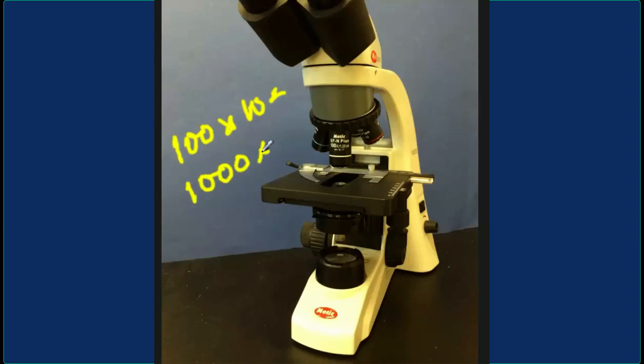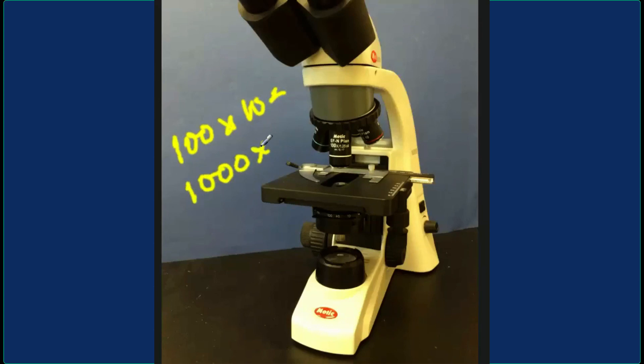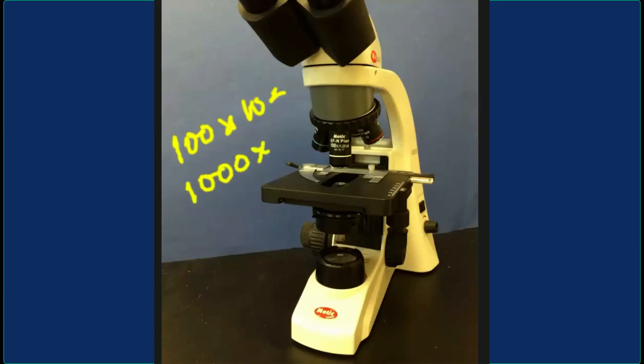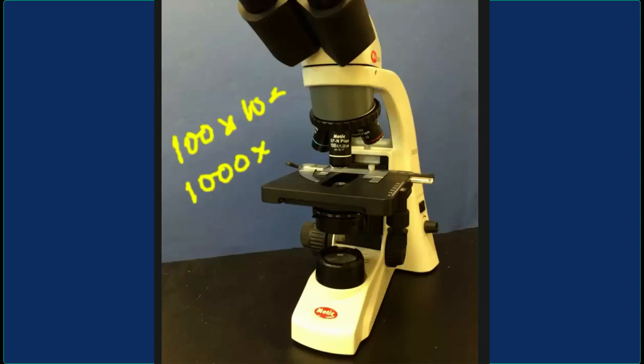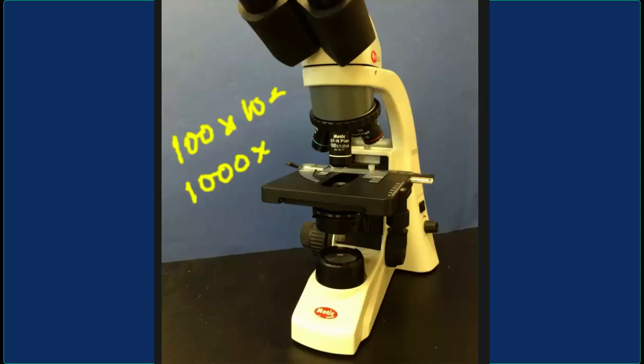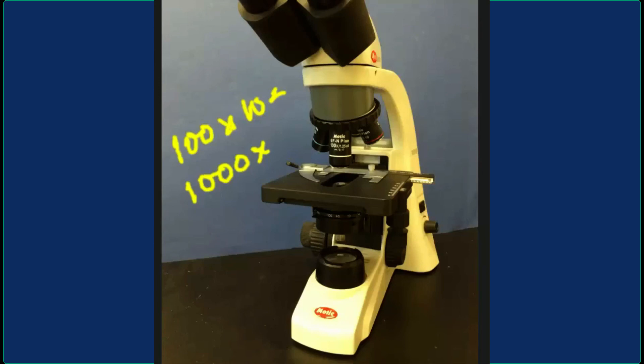That is about the boundary where this type of microscopy ends. To get better magnification, you have to use more advanced kinds of microscopy — like, for example, electron microscopy, which will enhance magnification by a factor of 100, so you can get 100,000 times magnification with an electron microscope.